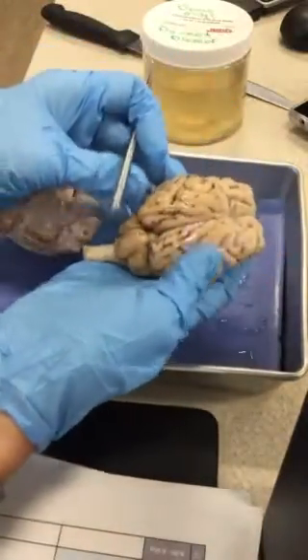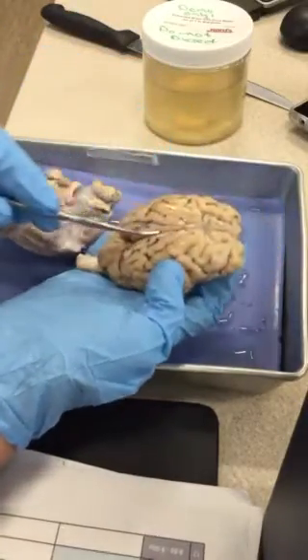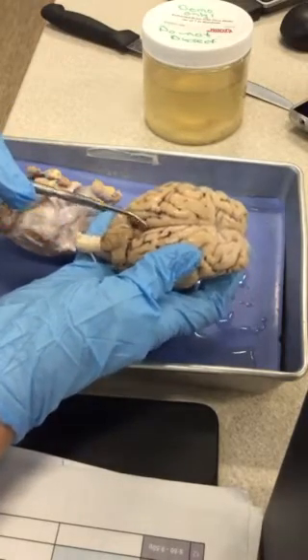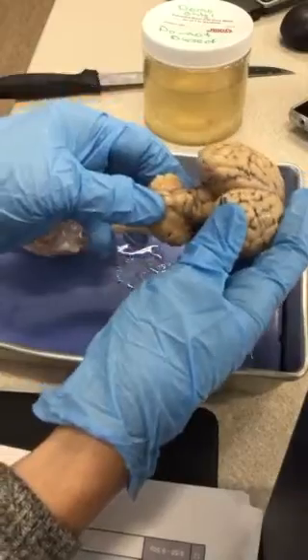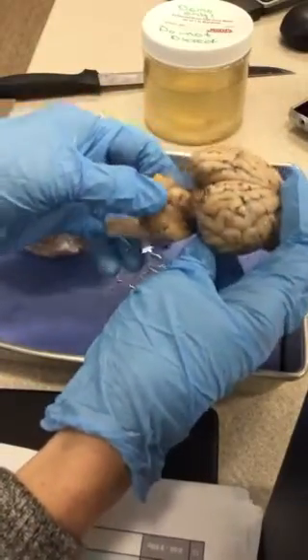Then looking at the next page, just looking at the more external features, the longitudinal fissure runs the length of the sheep brain. So longitudinal fissure. And then we need to cut this in half. So the best way to cut in half is, oh, one more thing. You want to show them the midbrain, pons? Because I'll do it from a whole brain view versus a sagittal cut.